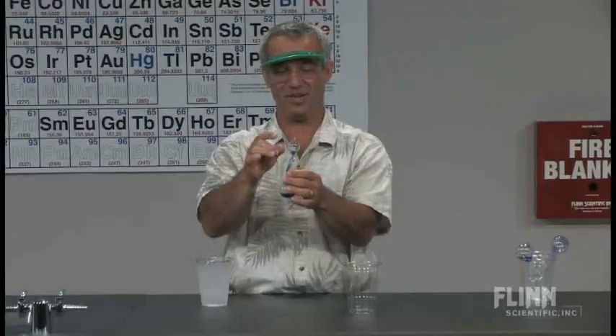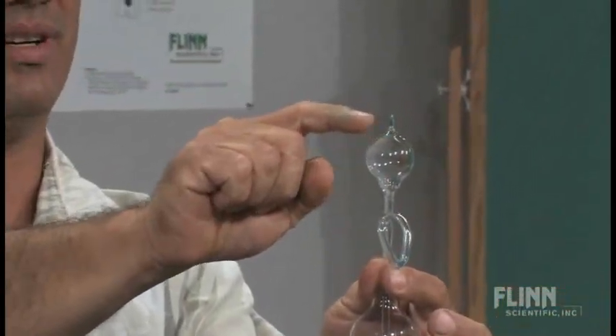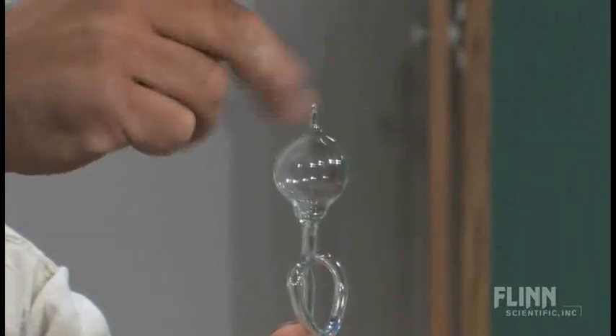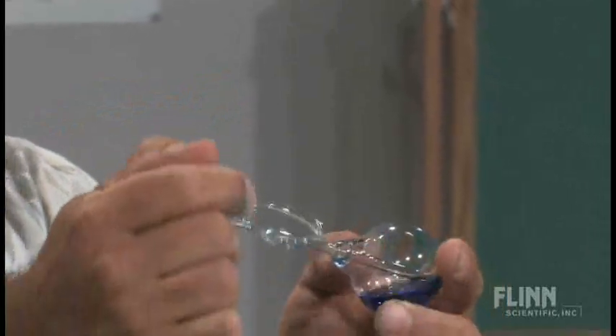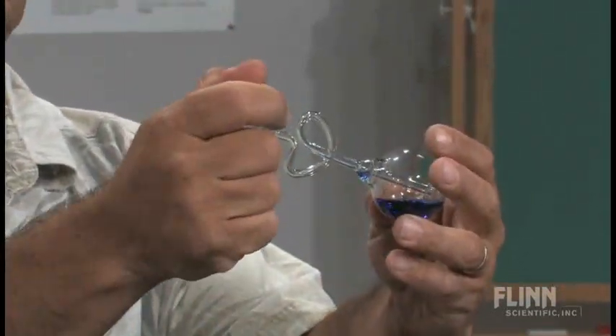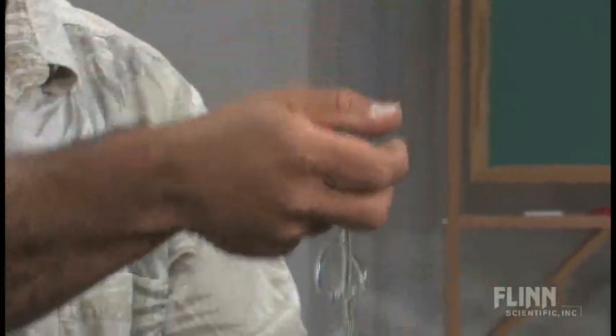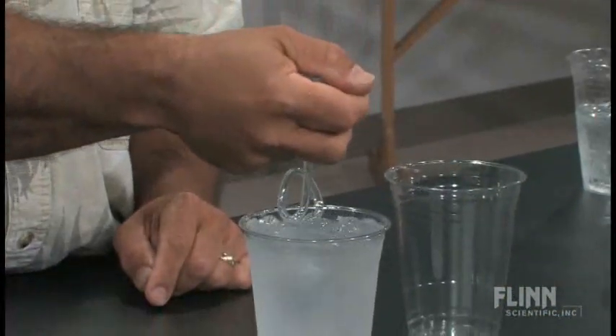So we right away set to work on this. To do this, you're actually going to try to completely empty what's called the top portion. I can do that like this — heating it up, getting all the stuff I can out of there. There's a little tip here that seems to capture a little bit of the liquid, so you can tap that and it empties out. I'm going to try to get everything out. It's not perfect — there's still a little bit left. Now I'm going to warm this with my hand and plunge the other end into this ice water. I'm swirling it around.